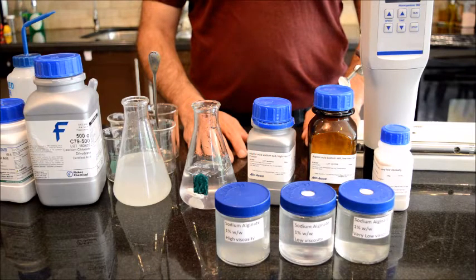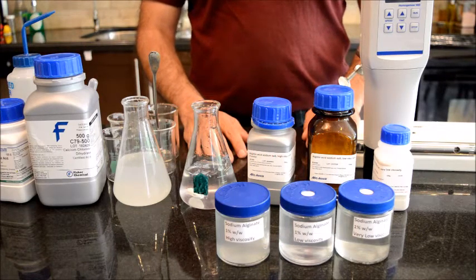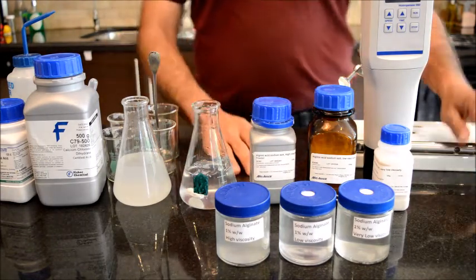Today I'm going to talk about alginic acid gel and different types of alginic acid gel that you can make at home. For chemists who are doing reverse engineering, I will later talk about the analytical aspect of this work, and I will tell you a method that you can use for the quantitation of this excipient in your pharmaceutical product. I have three different alginic acids here.